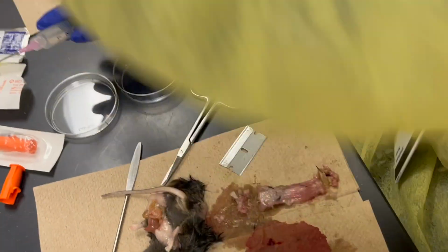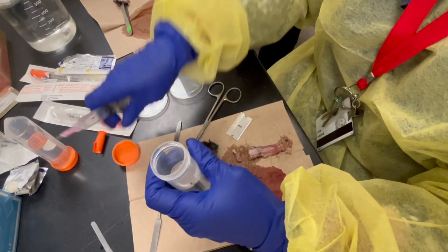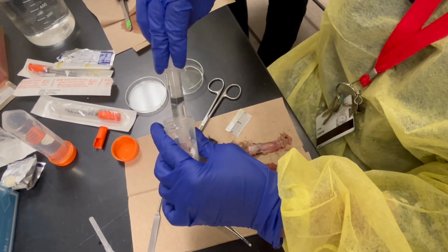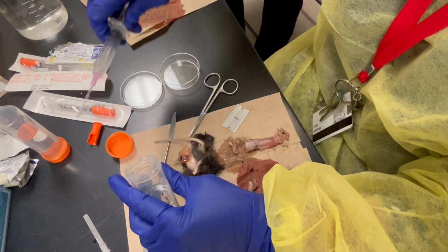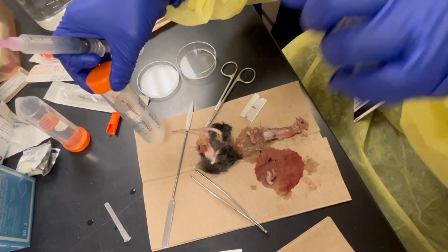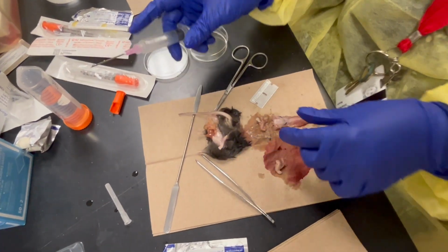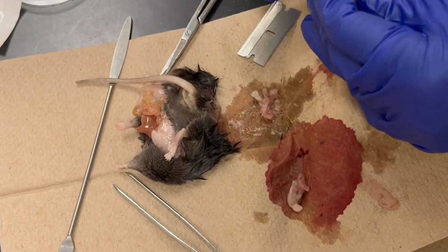Yes, I need a little bit more. This is DPBS, not PFA. It's a little frosty. It's okay. But you guys kept the bottle sterile, yes? Yes. That stuff was already aliquoted under the hood. Okay.